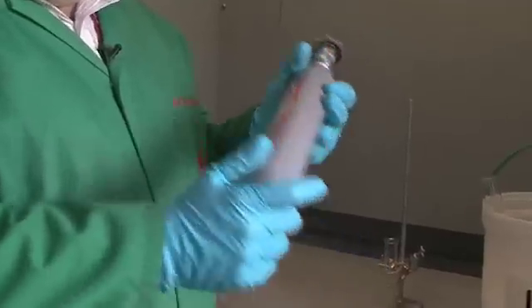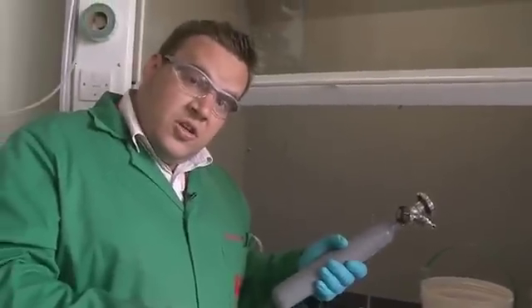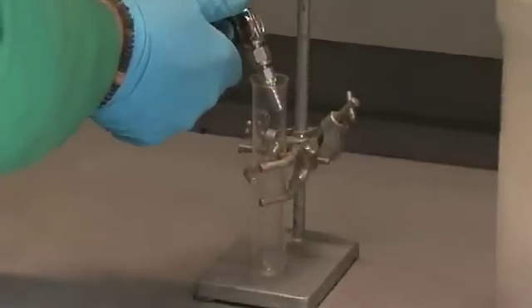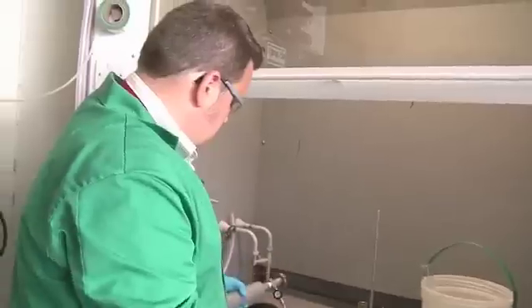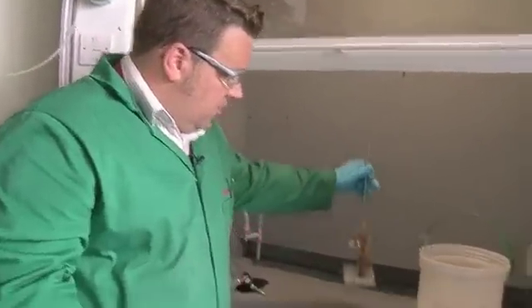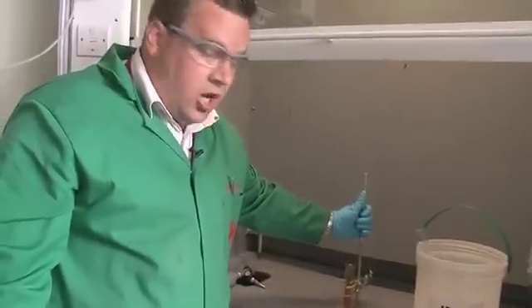Here's our cylinder of N2O4. It's quite an energetic mixture and we're going to use it as an oxidant for this hypergolic reaction. So we open the valve, open the second valve slowly, and allow the gas to dribble into the test tube. You can see there's a very nice orange liquid in the bottom — it's vaporising and forming quite a heavy, dense gas sitting above the liquid. That's our oxidant, the first component of our hypergolic mixture.